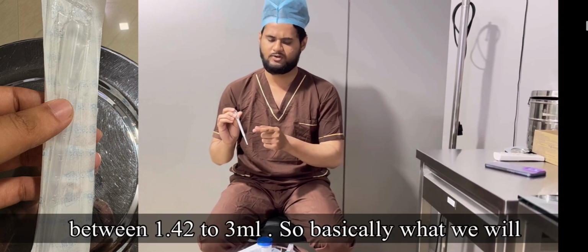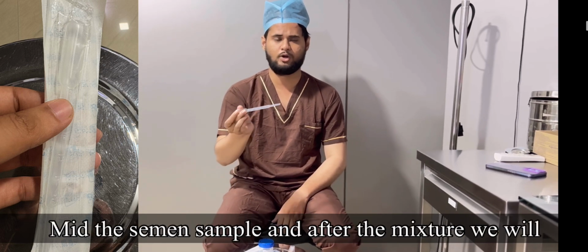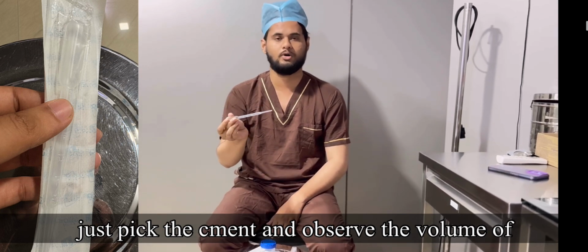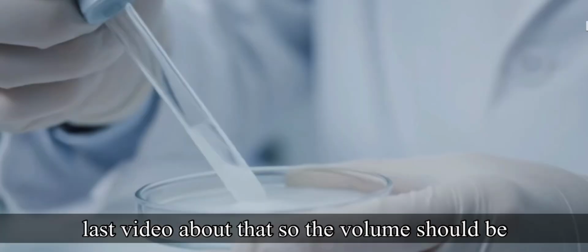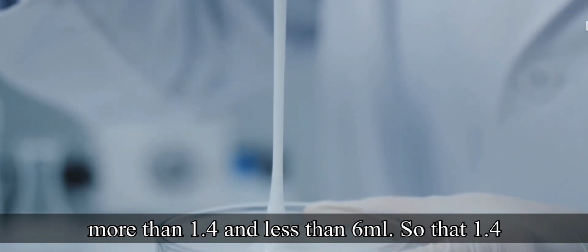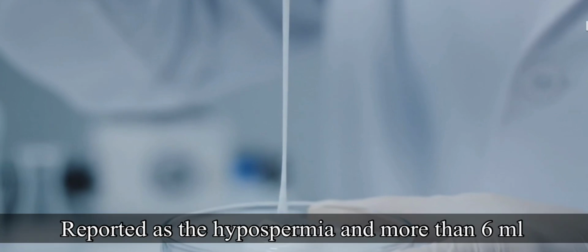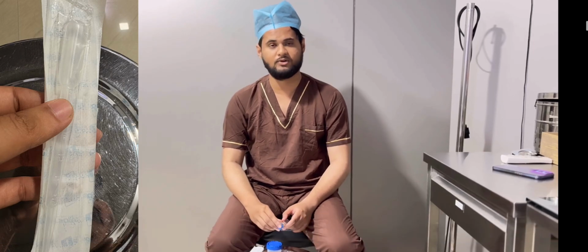We can also use the dropper to mix the semen sample. After mixing, we will pick up the semen and observe the volume. As per the WHO, as we discussed in the last video, the volume should be more than 1.4 and less than 6 ml. Less than 1.4 will be reported as hypospermia, and more than 6 ml will be reported as hyperspermia.